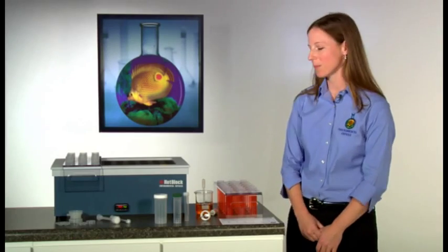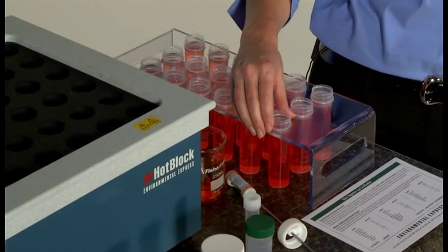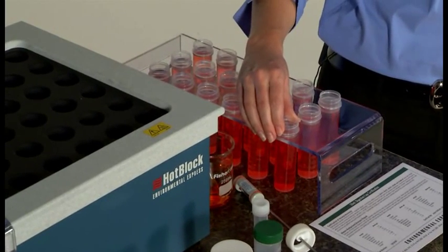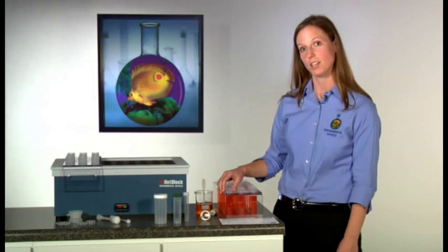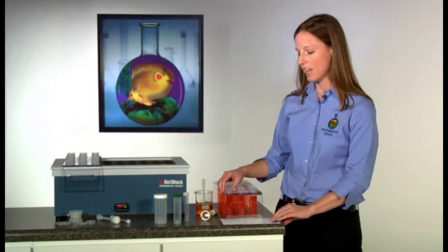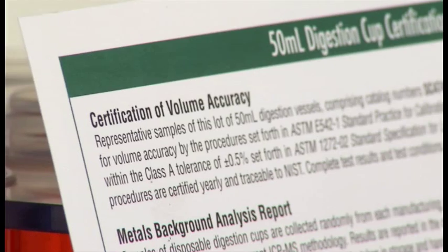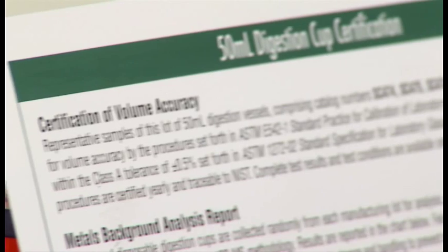To use the hot block, bring your samples up to volume using the graduations on the digestion vessels. Environmental Express digestion cups are volume certified and each box is packaged with a certificate of volume and cleanliness.